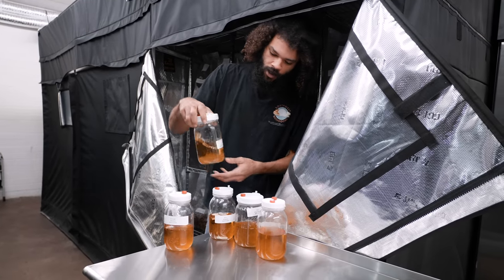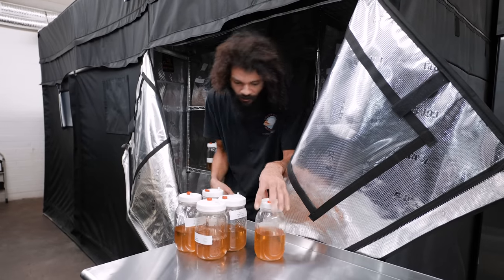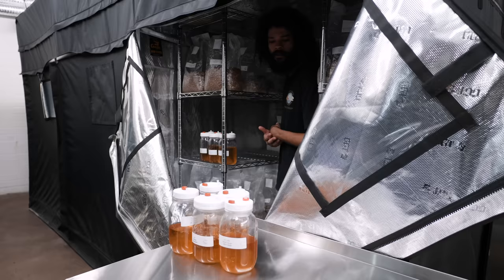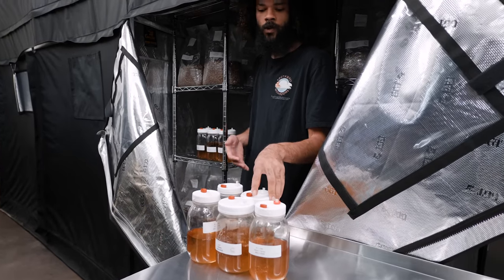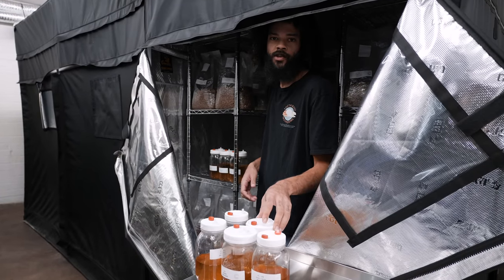I'm just getting ready for a lab day. I'm going to go in and do some inoculation of grain spawn, and we're going to do a few different ways of inoculation — some with liquid culture, some agar dishes, as well as some grain-to-grain transfers.